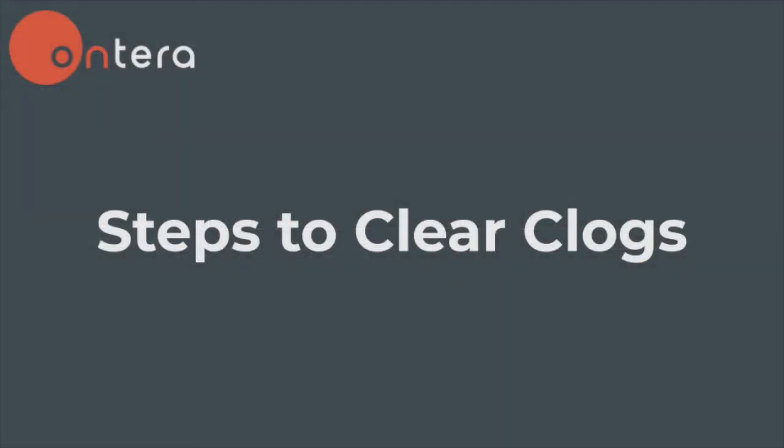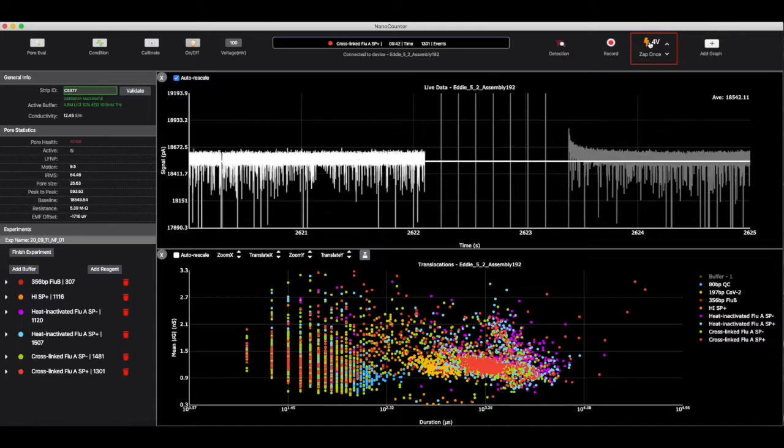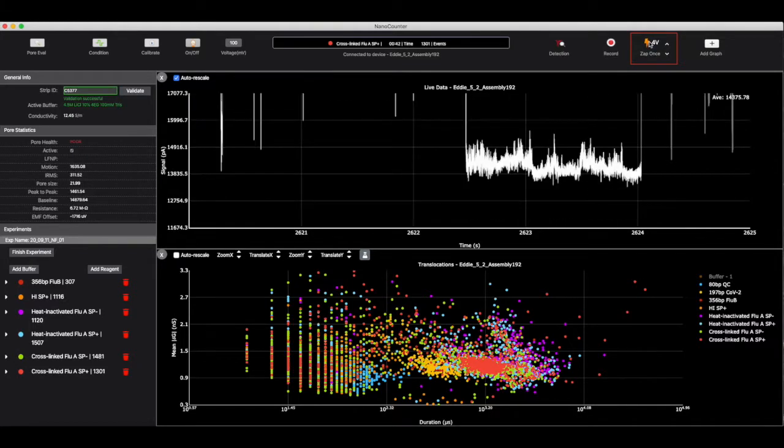There are a number of steps to take to clear clogs. Each step is more aggressive than the previous, so it is important to follow these steps in order. Otherwise, you could cause unnecessary damage to your nanopore. Your first response to a clog should always be the zap function. Zap will apply pulses of high voltage to the pore, which is very effective at clearing debris. Zap will pause event detection, so you do not need to worry about zapping in the middle of a sample run.